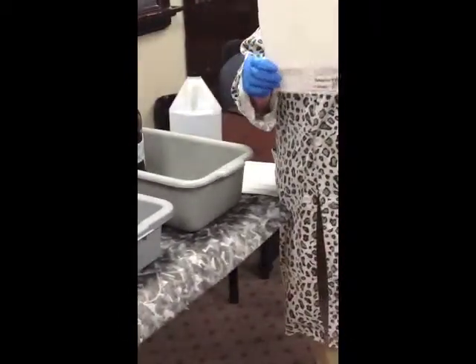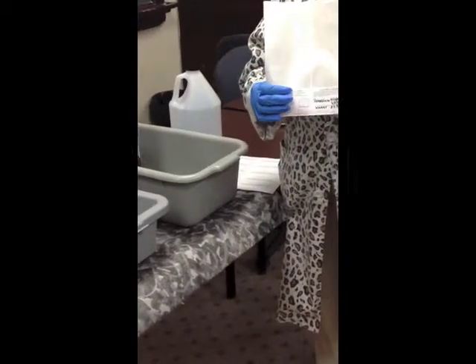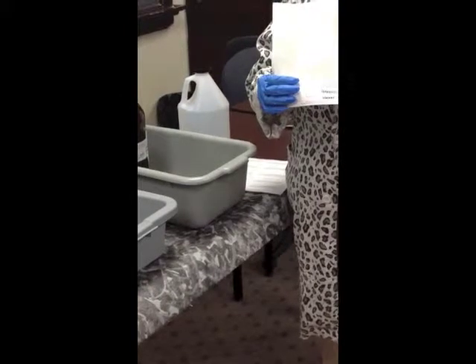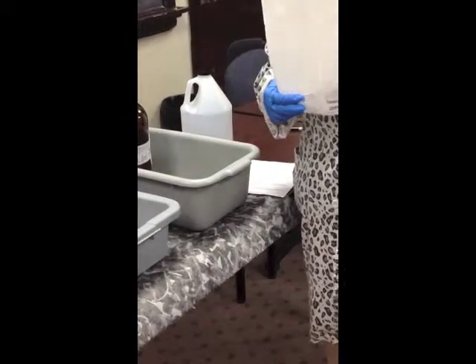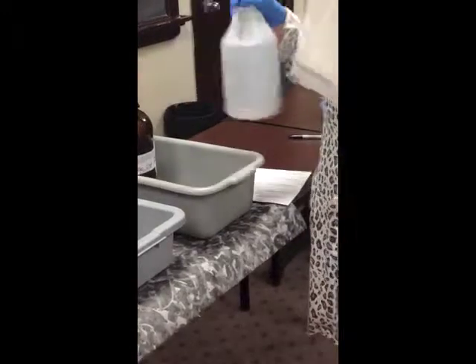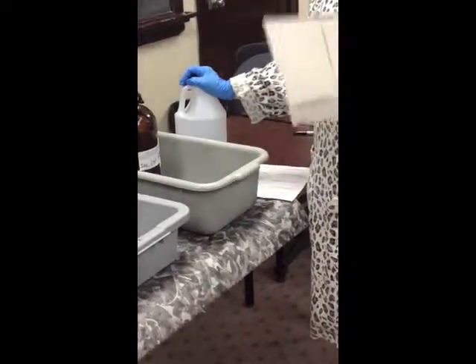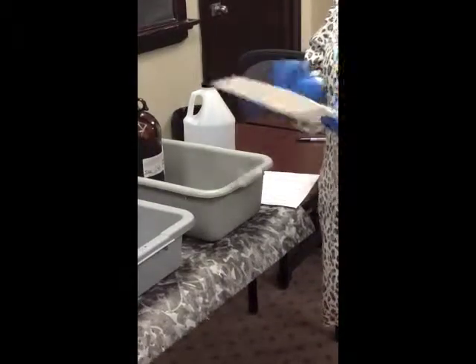The other things that you need to put on that label are the constituents, and you need to put all of the constituents. This container we're filling with potassium hydroxide in water. So on the label we've listed potassium hydroxide, 75% because we know the percentage, and the water is 25%. Then we have the hazard. You need to put a hazard that indicates you made the determination it is a hazardous waste and why. Hazards would be things like flammable, corrosive, toxic, oxidizer, reactive. Those types of things would be acceptable on your waste label.